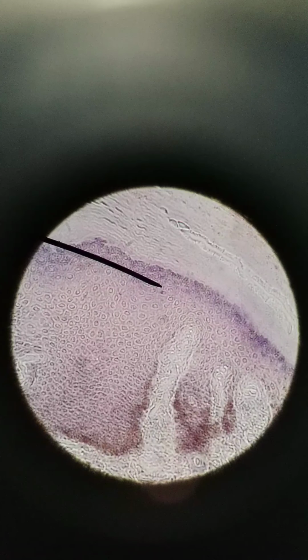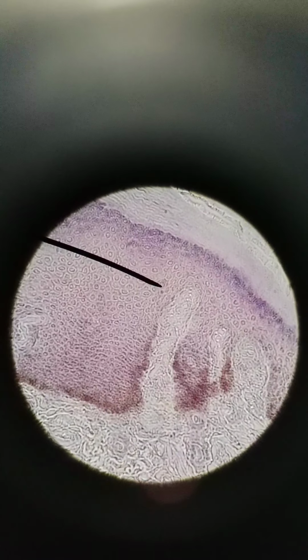Once again, stratum corneum, very thin, dead, flaky. Stratum lucidum. The darker stuff here, that's stratum granulosum. It has granules, grainy looking, because of the keratohyalin, which dries out the keratinocytes. Stratum spinosum is this bigger, lighter layer, and then stratum basale is the single dark layer at the basal layer of the skin. Separating the epidermis from dermis is a basement membrane.